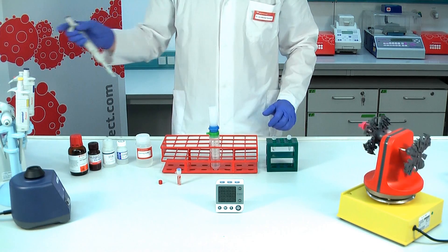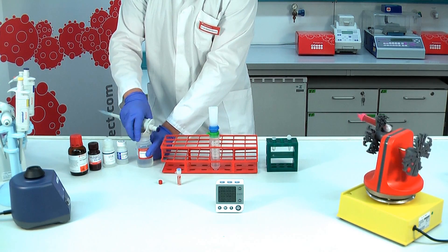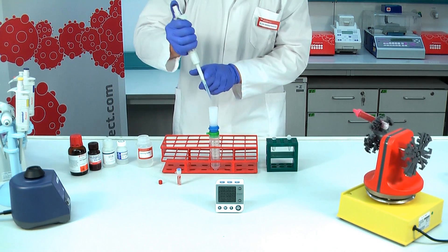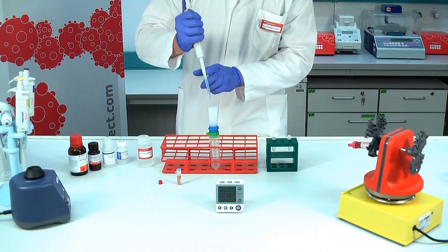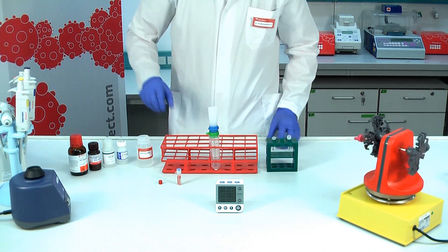You can already add washing buffer to the funnel. Let's forward to the end of the incubation.